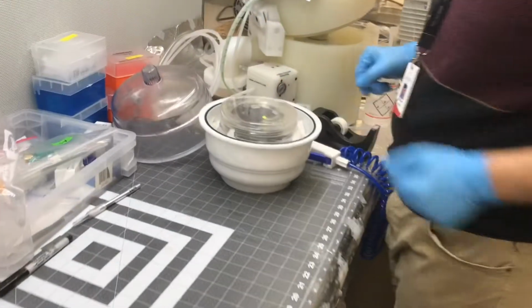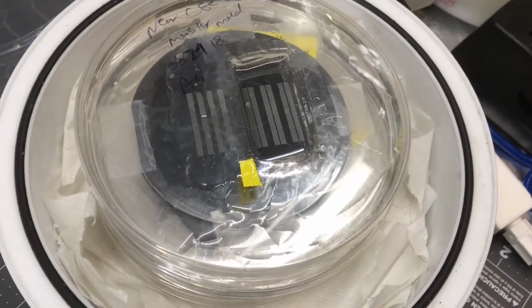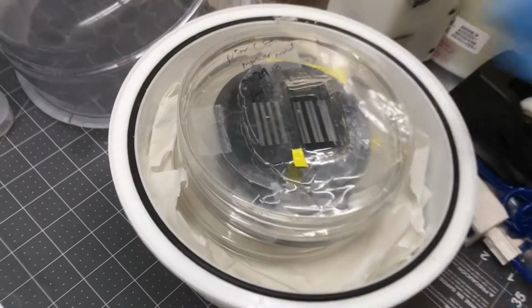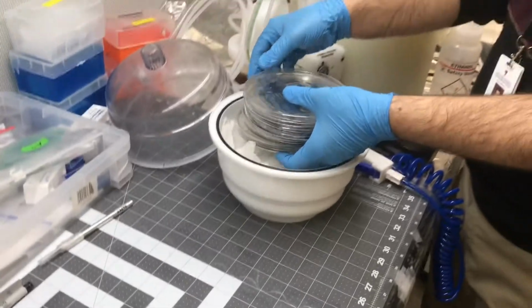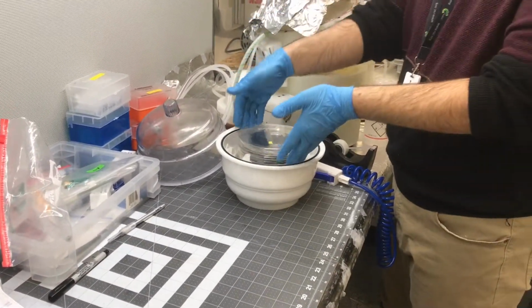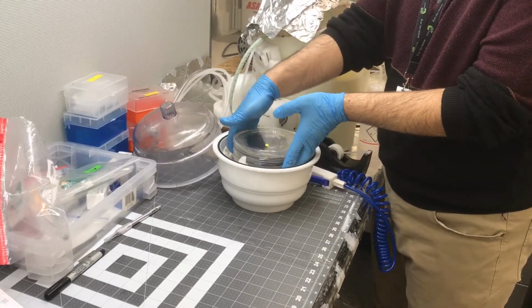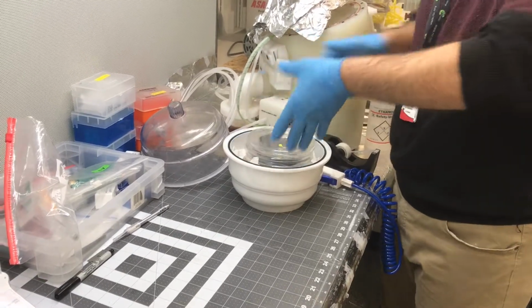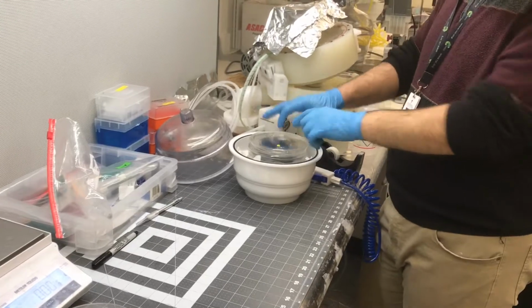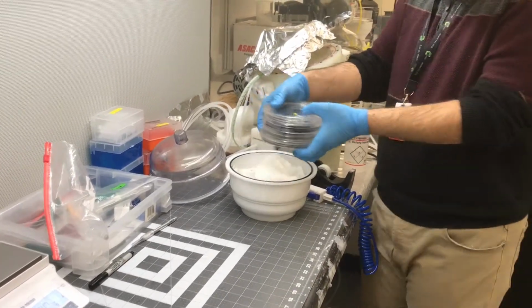So can I now focus on what you are saying, that on the edges there might be some bubbles? Yeah, but it doesn't matter for us. Then you remove your chip. Be careful when you take your master mold. You put both hands like this and then take it. Do not take it by one hand like this, because it tilts. When it tilts, because it is still a liquid solution, the thickness will vary. So for this reason, just be careful.